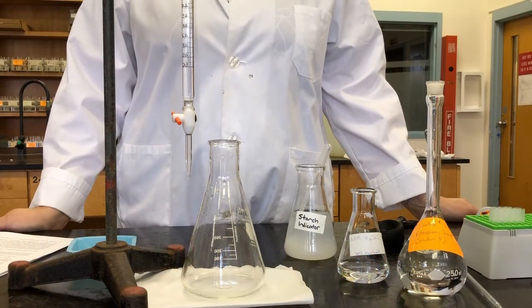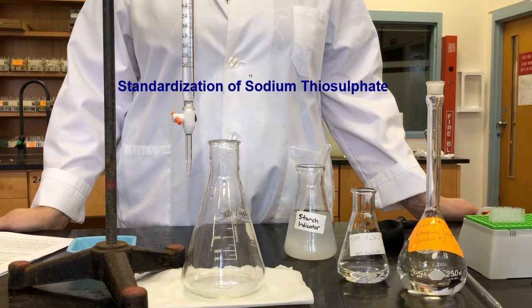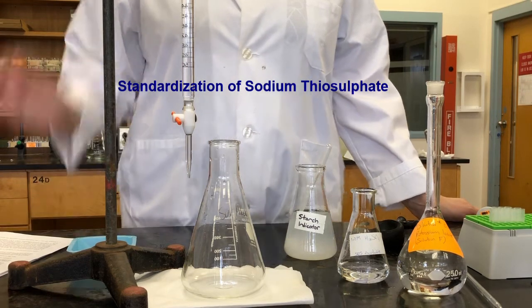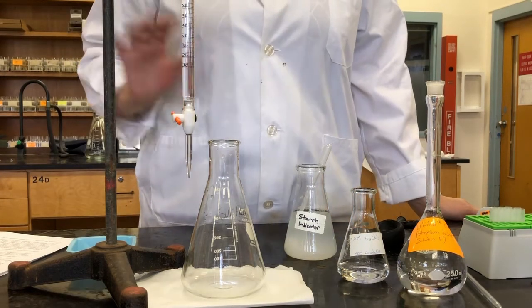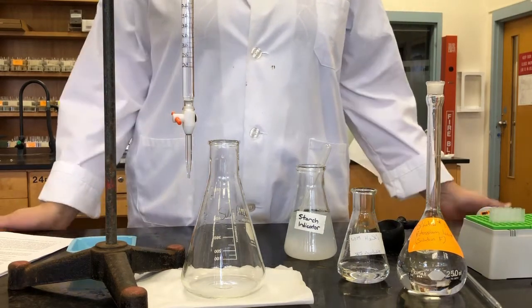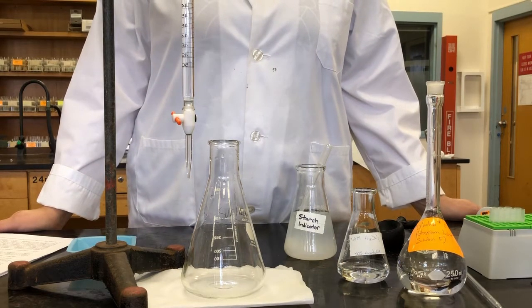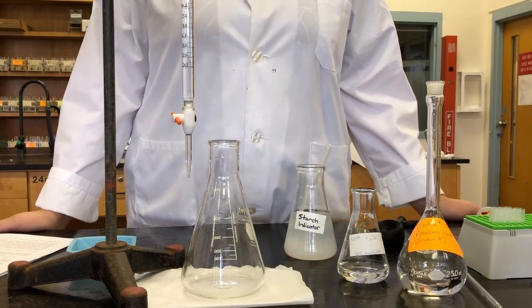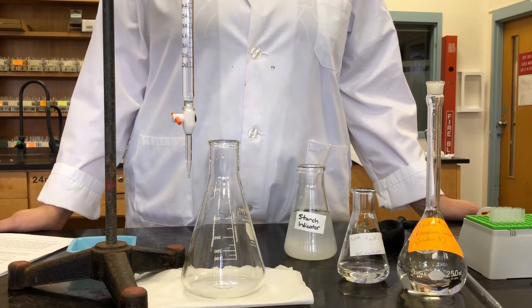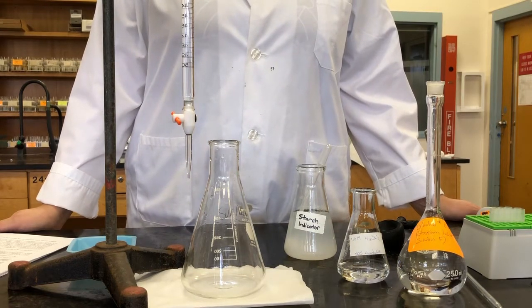Okay, so let's start our standardization procedure for the sodium thiosulfate solution. So once again, we have our sodium thiosulfate in the burette here. That's the same solution we used last week. We're just going to standardize it again to make sure that there hasn't been any change in concentration since last week. So there can be minor things like evaporation of a small amount of water, and even a small amount like that can affect the concentration. So we always want to make sure we standardize it again anytime we run more samples.